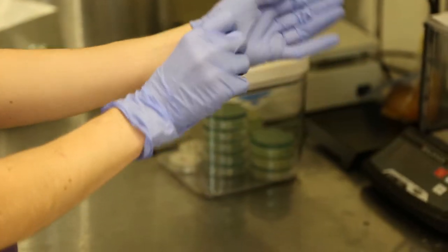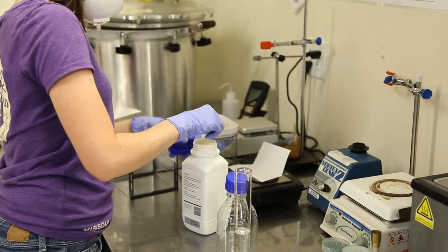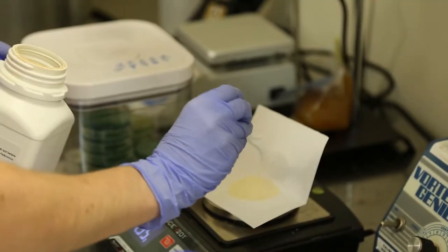This is our lab area. This is where we take samples from various points in the brew production process to test for the presence of beer-spoiling microbes, as well as to confirm the presence of microbes that we want to see in our brews, such as house yeast.